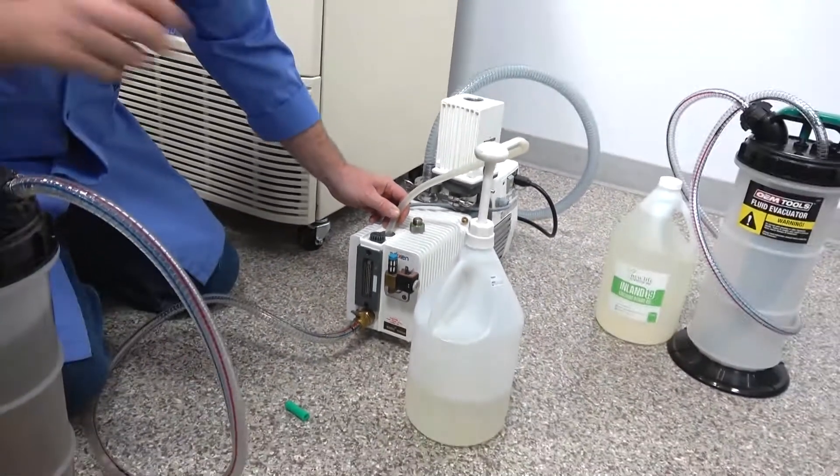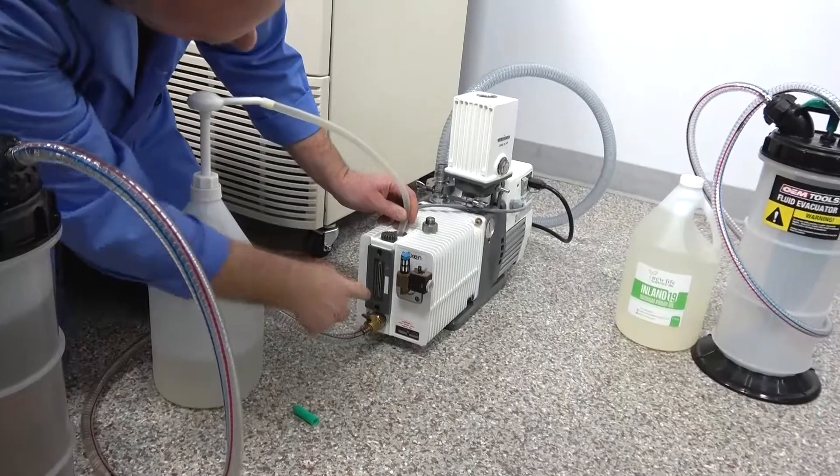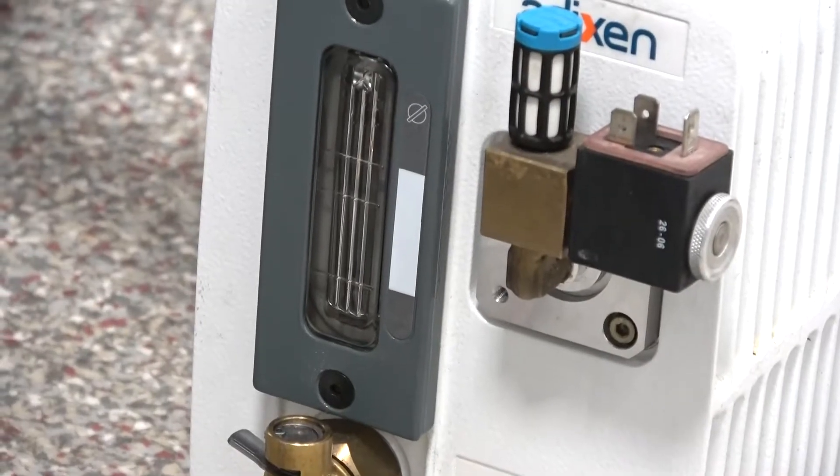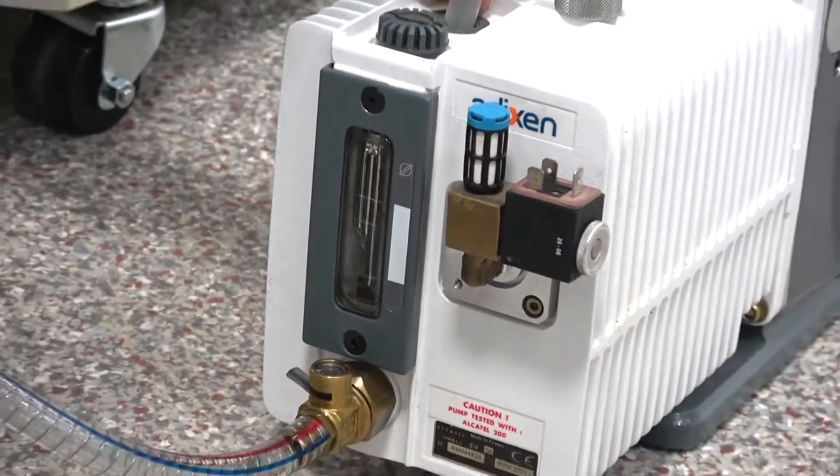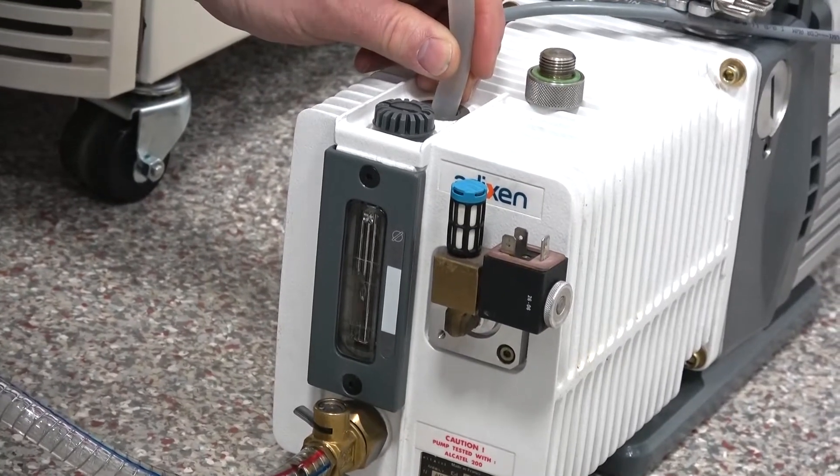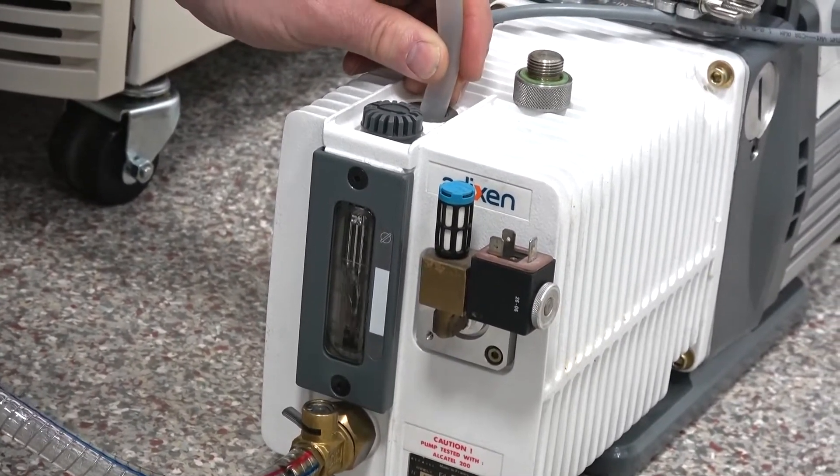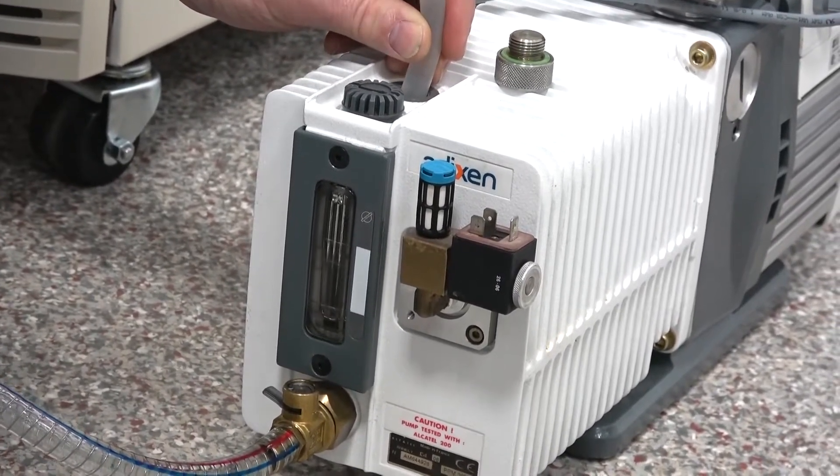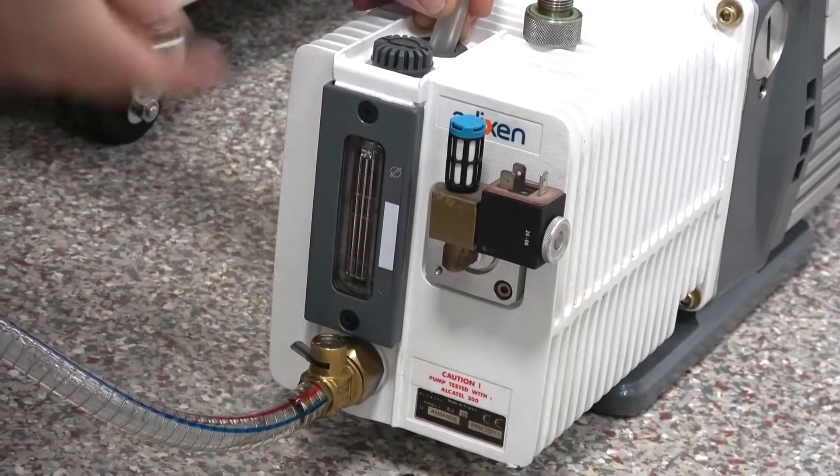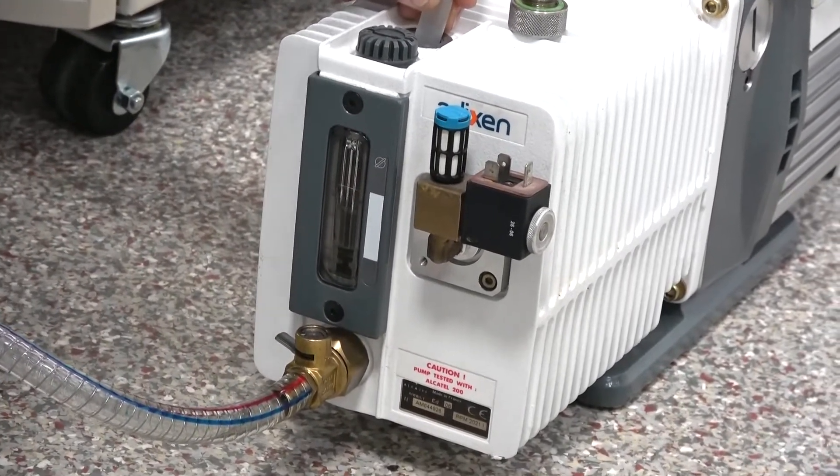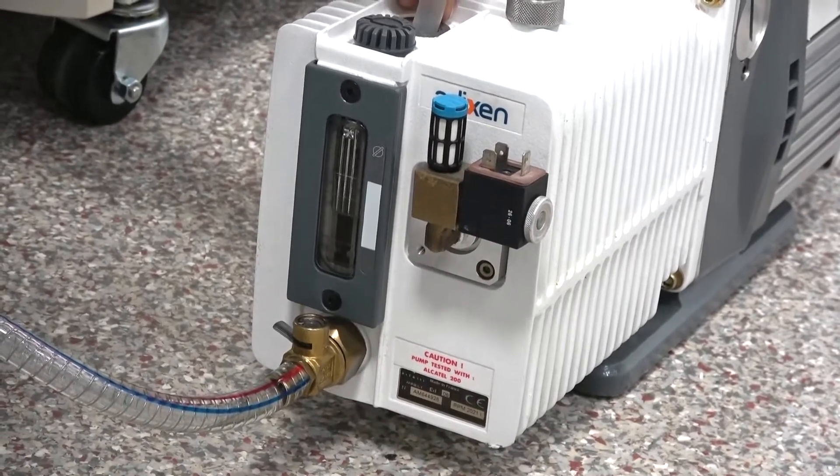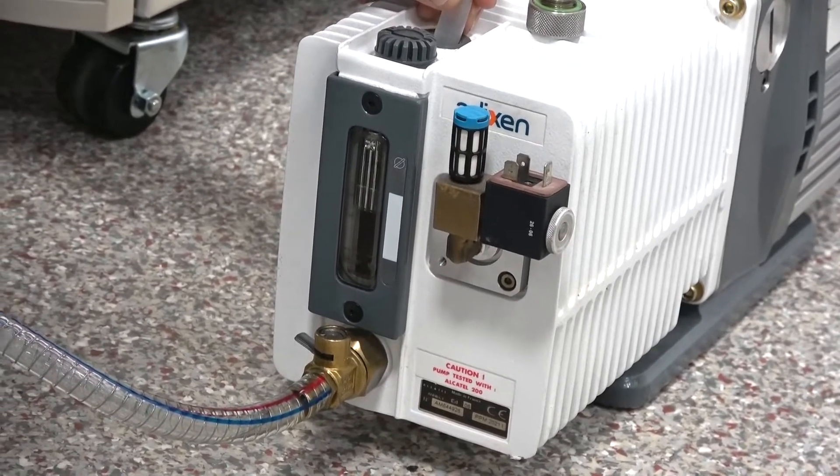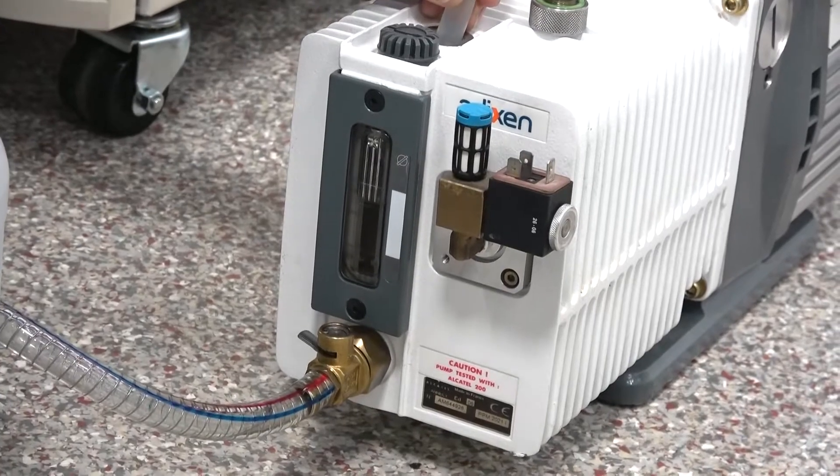So we've evacuated the old oil, and now we're just going to watch this, and we're going to pump in new oil. And then when it gets up to our marks, and you can see down here, it's still way down here yet, so we've pulled a lot of oil out of it when we evacuated it. Okay, we're coming up real quick now. So we slow down, and we're wanting to get it right in between the two marks there. And there we are.